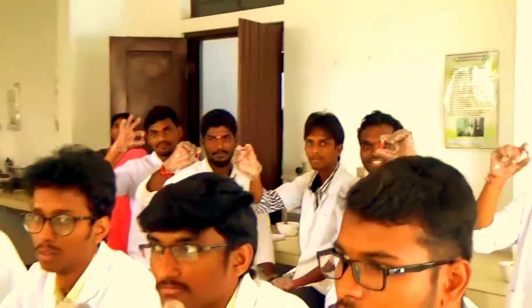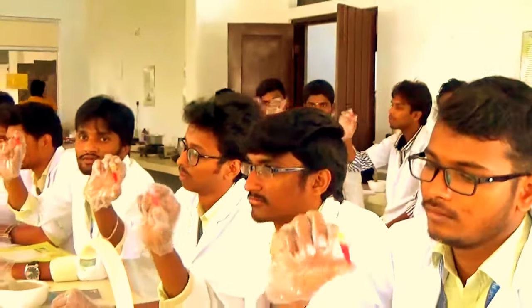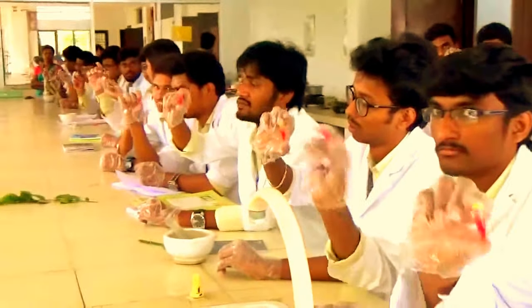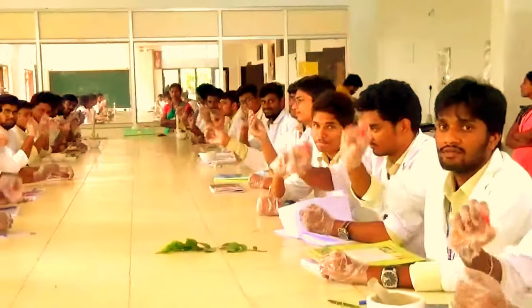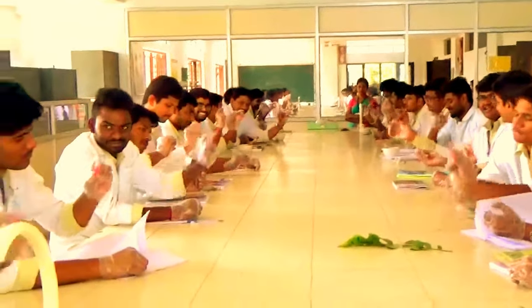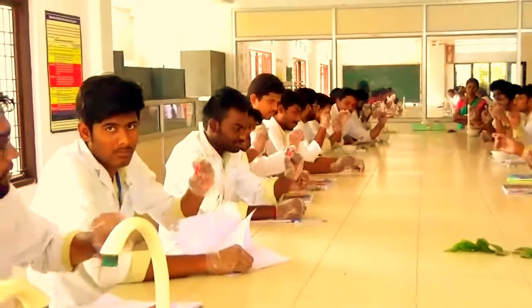Now shake it. Shake it as fast as you can. The fast shaking is required here to break the RBC, and then after we will go for the WBC separation.